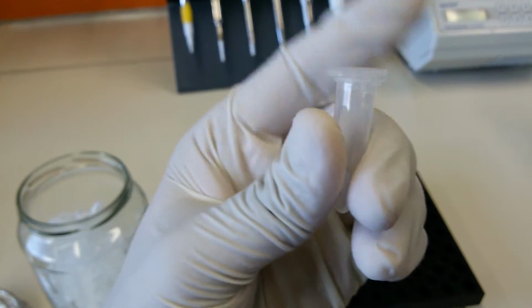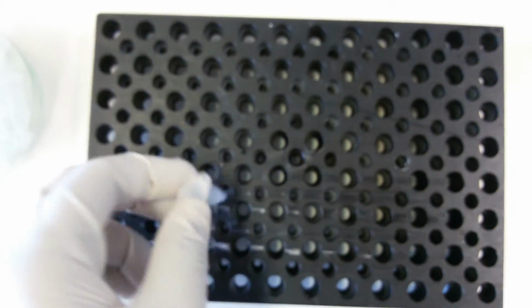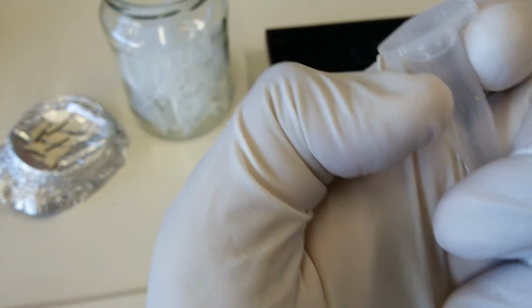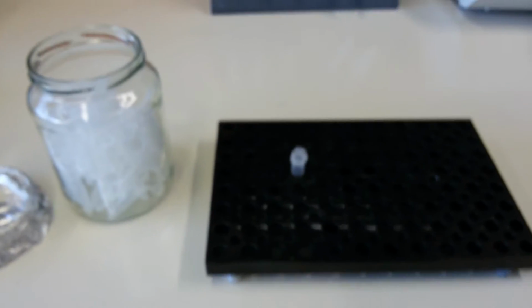We close it and we can open them like this. And this is the stand which we use. For example, put it like this so you can see it from the top. You put them like this, just ignore those small holes there for the different Eppendorf tubes. On the top or on the side, you can write the name, or something if you want to specify something. So this is the most important lab utility.